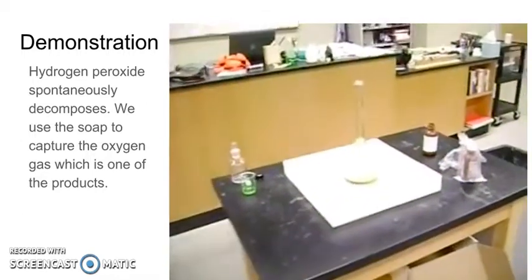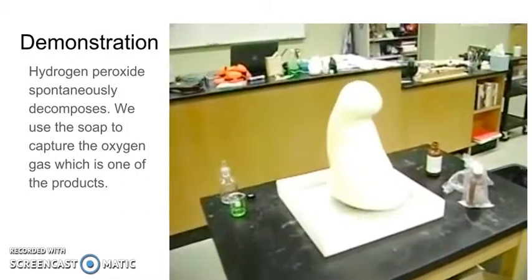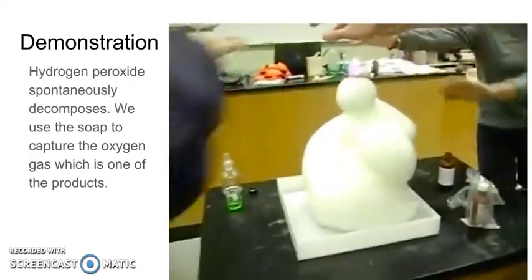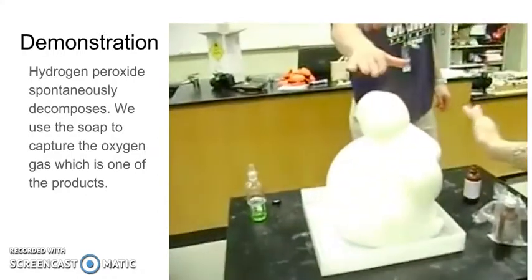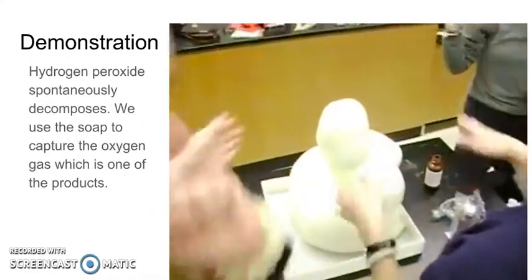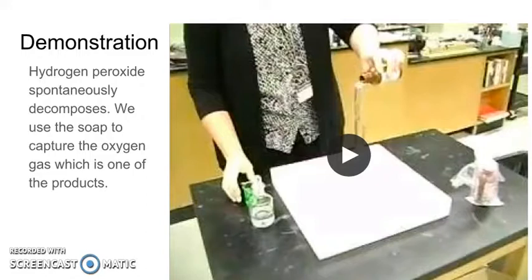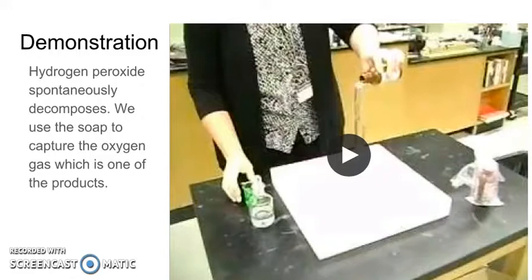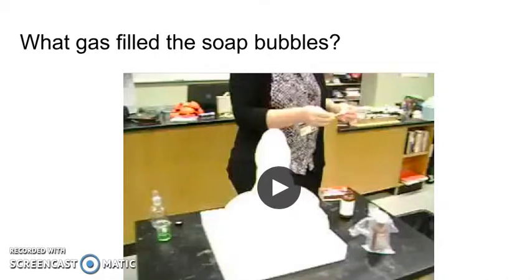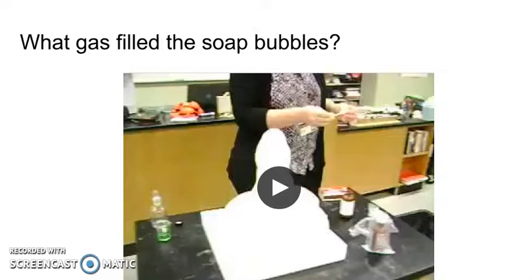There we go! From the video, you can see that the students were holding their hands over the experiment and it was very hot. So it's an exothermic reaction, meaning the system loses energy to the surroundings, and the products are more stable than the reactants because energy is being given off and released.